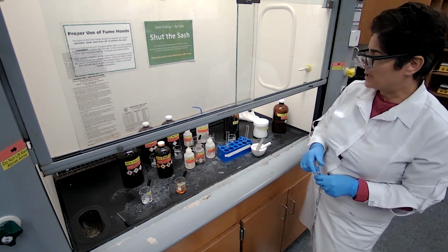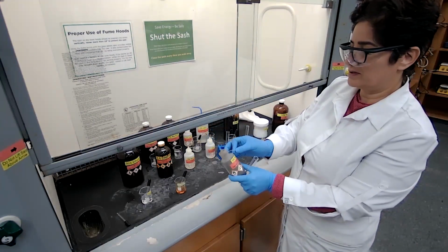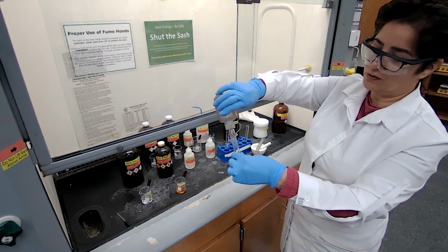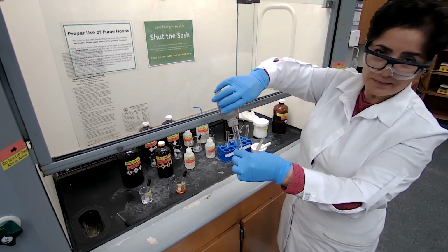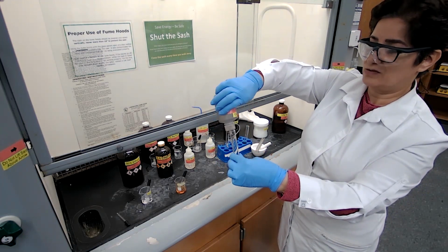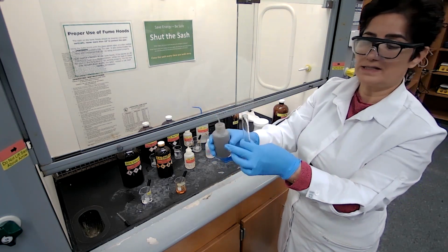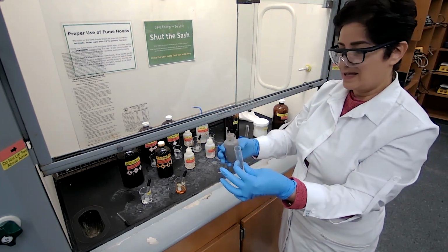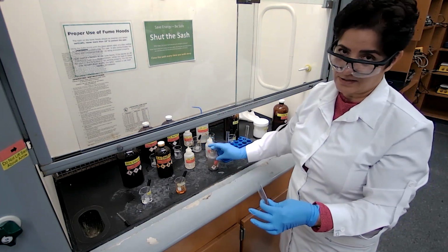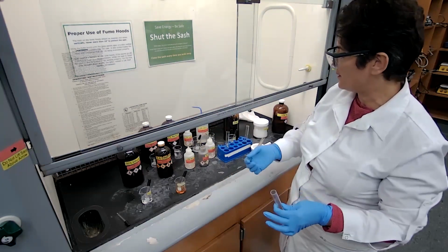To make the Tollens reagent, I'm using 5% silver nitrate. You have the procedure. Just add 2 milliliters, which for me is about 40 drops, because I prefer the silver nitrate to stay in a dropper bottle. If it touches your skin, it's going to cause a black stain, and only time is going to remove that. Basically, it oxidizes something in your skin, and it leaves a black stain, and your skin will peel off before it comes out.